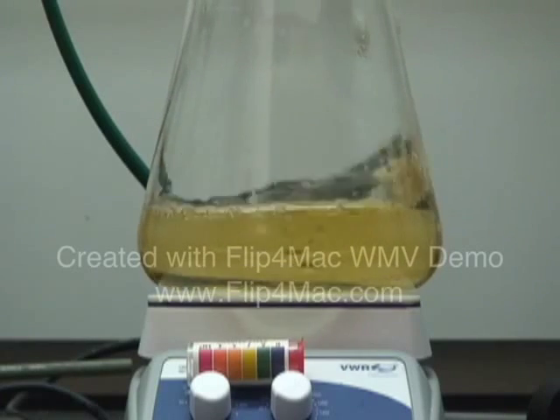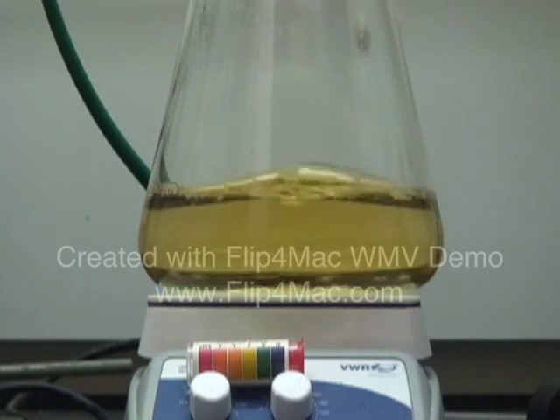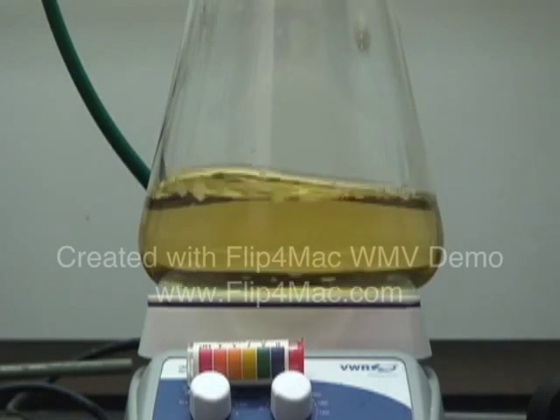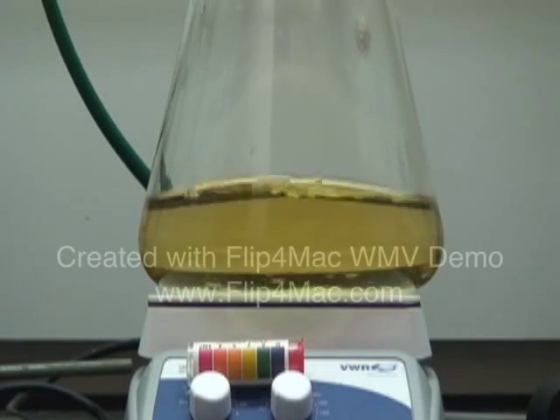So here we have our initial solution that has a pH of 7.